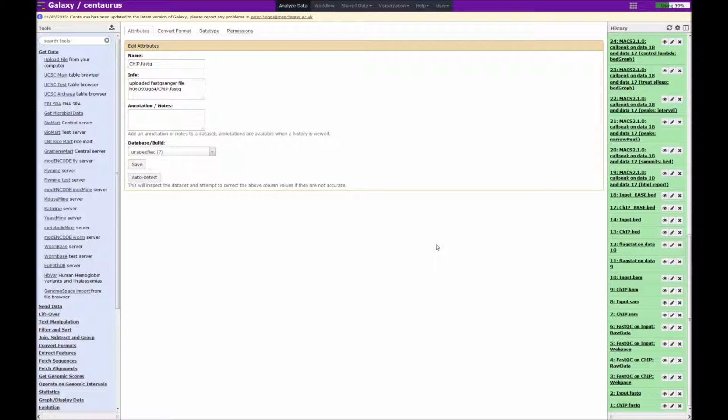Now, unlike the last time we looked at Galaxy, this is now our own instance of Galaxy at the University of Manchester. So it will look somewhat different to if you loaded up Galaxy main. So as before, we have all our tools or bits of software on the left hand panel. In the middle is how we interact with those programs and where you can look at results. And on the right hand side is a history, which in this case is the ChIP-seq analysis.